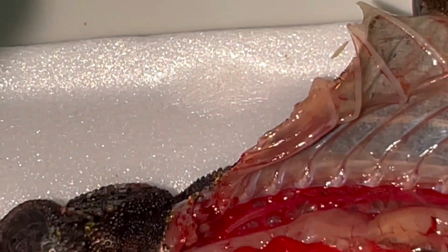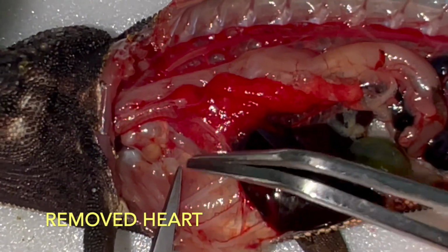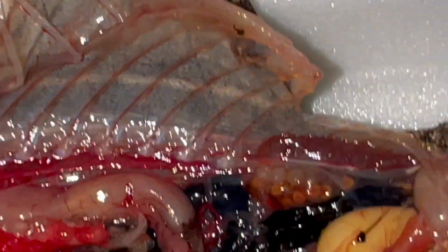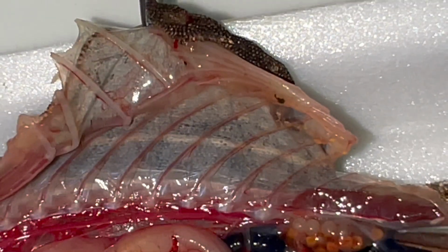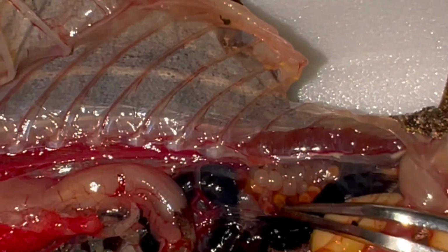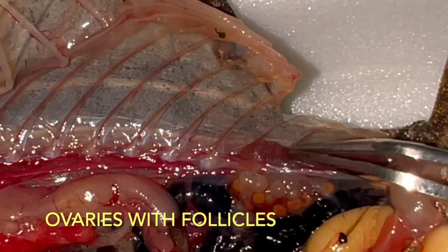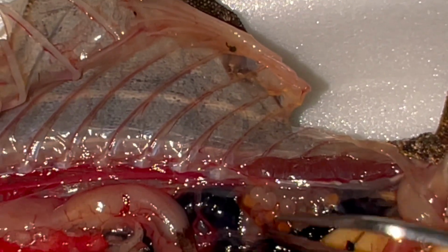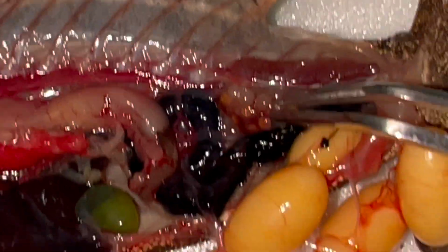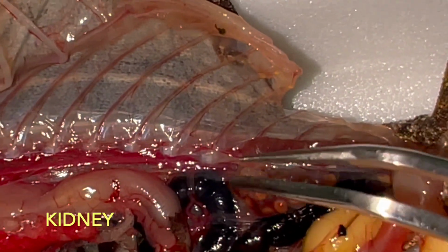Here we removed the small heart. You will see it on some other pictures. And here in the bottom of the pelvic area, you can see an organ which is responsible for the detoxification of the animal, which is the kidneys.